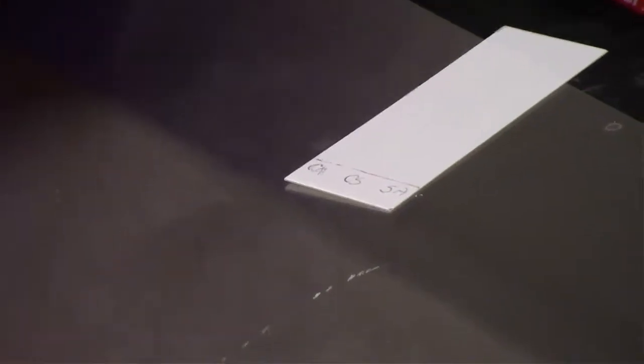It looks like the pencil line was a little bit too much, so you can see some of the silica gel off the plate. You probably want to draw quite a bit lighter than that. So even if it's not super clear what the labels are, if you can just barely read it, that's all that's necessary. You don't want to alter the silica gel in any way. Basically what happens is if you scrape it off the plate, your solvent's not going to run evenly up the plate because it doesn't have enough silica gel to adhere to.